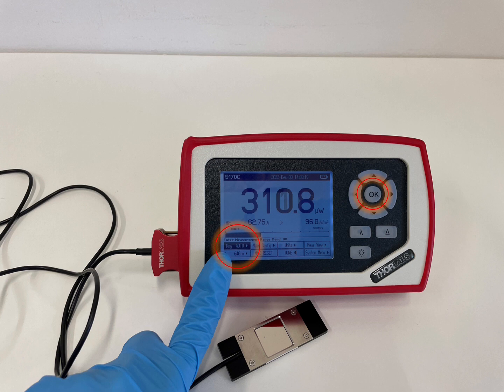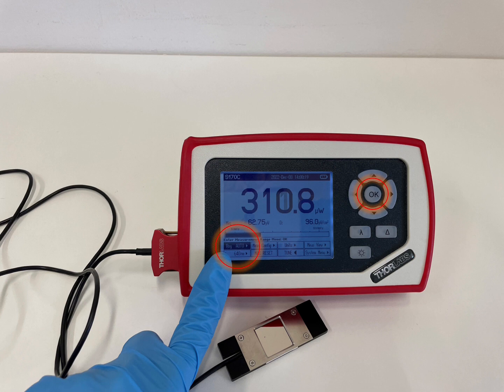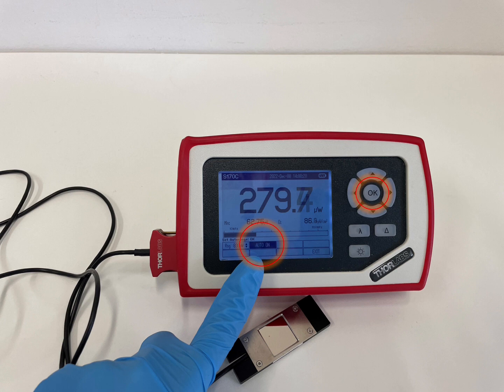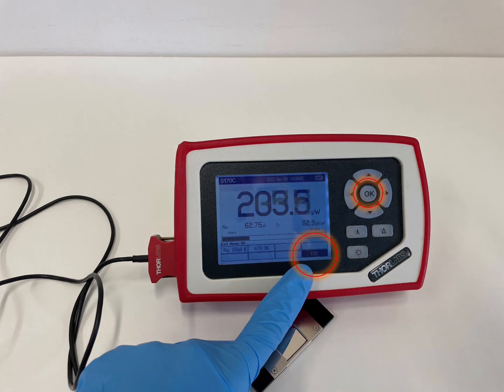Select the display range for the measured value. We recommend using the auto mode, which will assure that the number and units displayed match the intensity measured. To select the auto mode, navigate to the RNG field in the display screen and click OK. In the range menu, select the second field and toggle between auto on and auto off by clicking the OK button. Exit the menu by navigating to the exit menu and click OK.